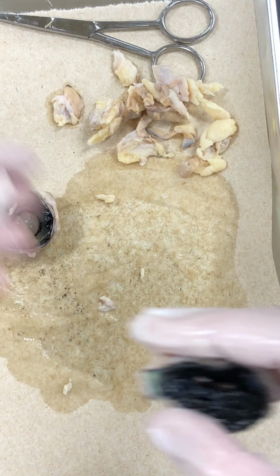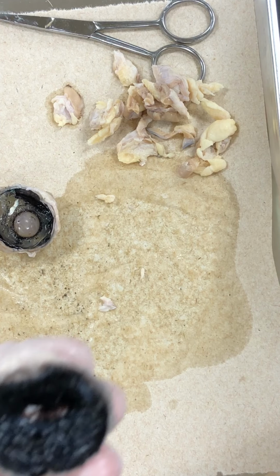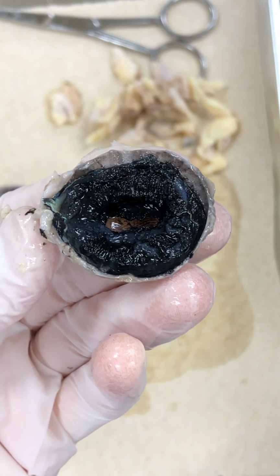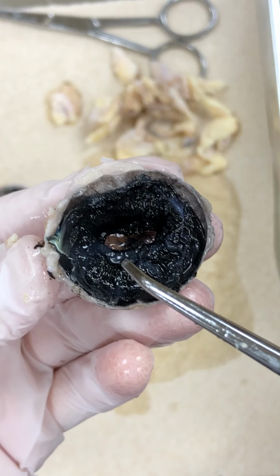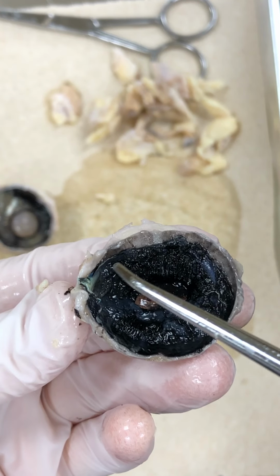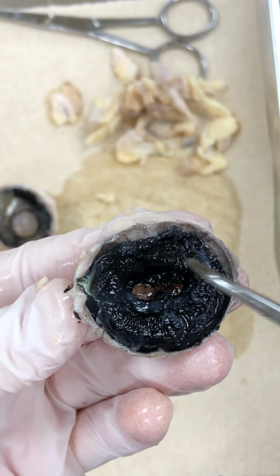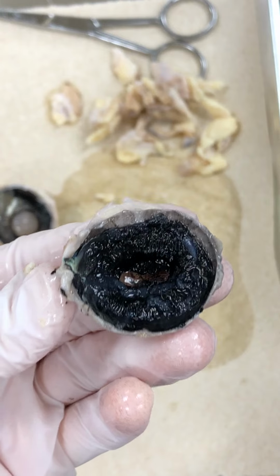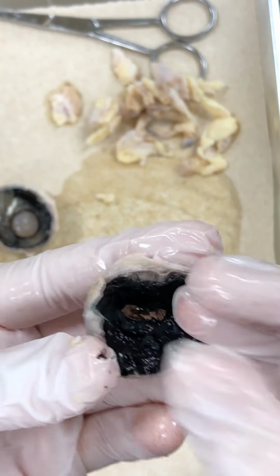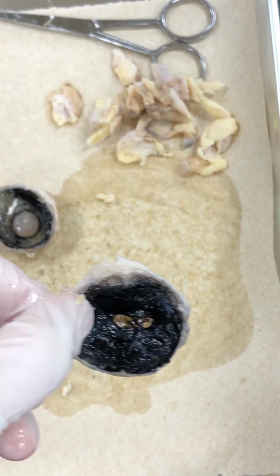Looking again at the anterior, here we can see those ciliary bodies. Where's my probe? They look almost like mushroom gills. So if you look in here, all of these little mushroom gill things going all the way around, those are ciliary bodies. In our diagram, it looks like they're just one on each side, but really it's all the way around. And then you can see the, at this point, translucent cornea there in the middle.